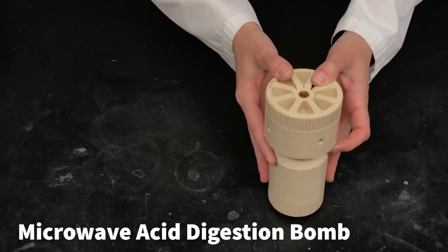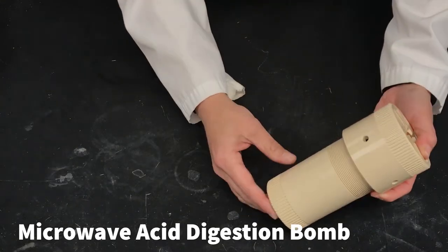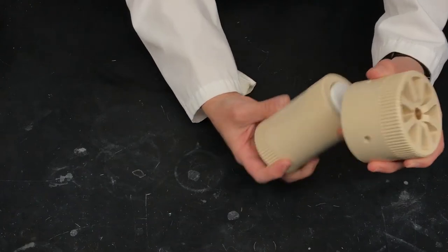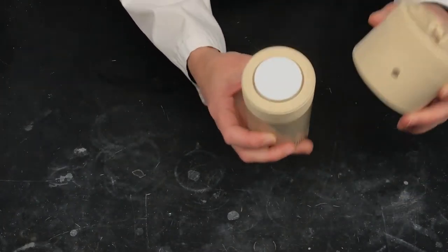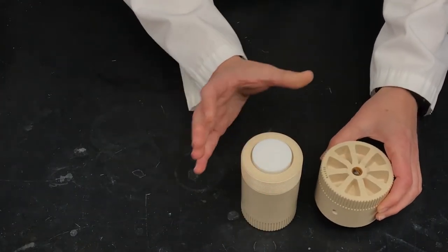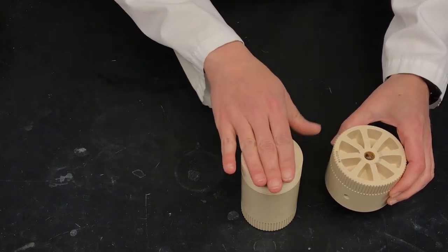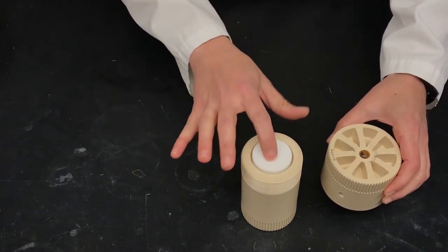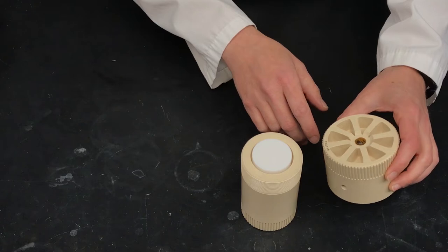Alright, so this is the Digestion Bomb. It's basically just a cup with an outer casing that allows for pressure and high temperature to be achieved inside this cup.